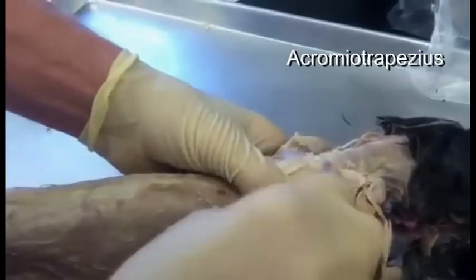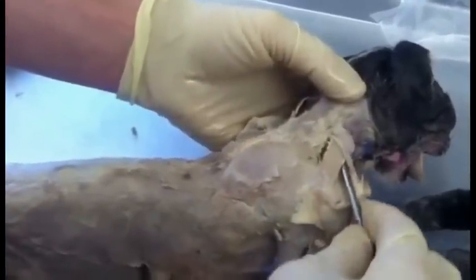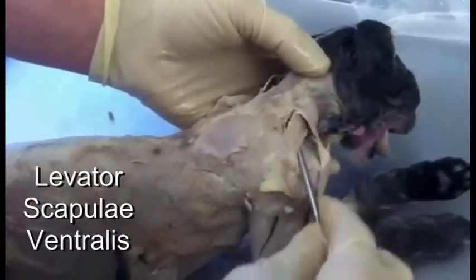The spinotrapezius forms a triangle. This line separates the spinotrapezius from the acromiotrapezius. There's one more trapezius muscle that goes up onto the neck, and that's the clavotrapezius. There's also a little muscle that goes up underneath the clavotrapezius — that's the levator scapulae ventralis.